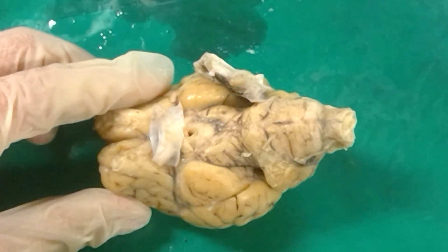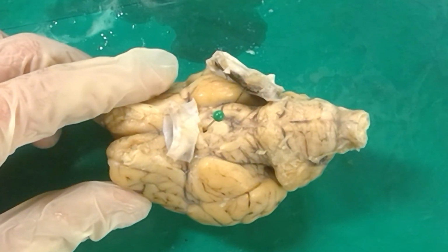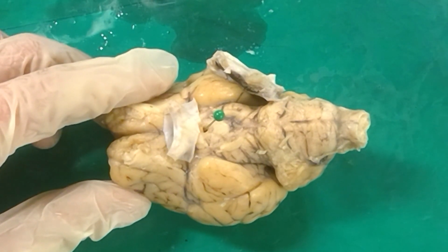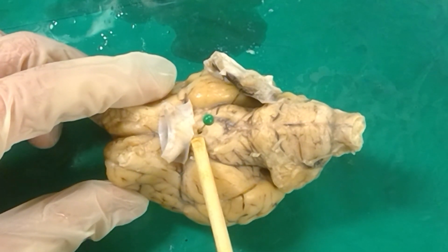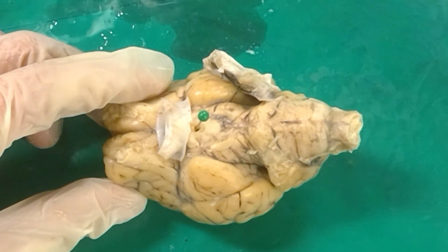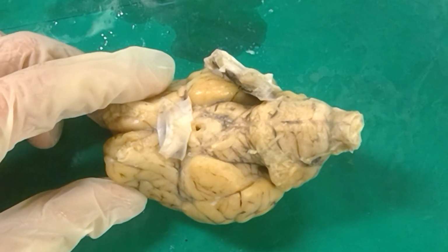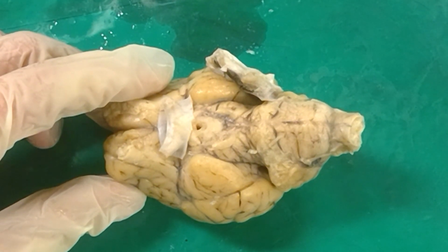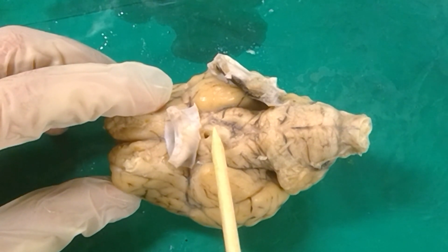And if we were to put a pin here, for example, during the practicum, into that hole, and we were to ask, name the tissue surrounding this space, and name the space inside the brain this pin is going through, the tissue surrounding this would be the median eminence, and the space inside the brain the pin is going through is the third ventricle. So any space inside the brain is known as a ventricle. Any space outside the brain we refer to as being a cistern. So that hole enters into the third ventricle, which is inside the brain.